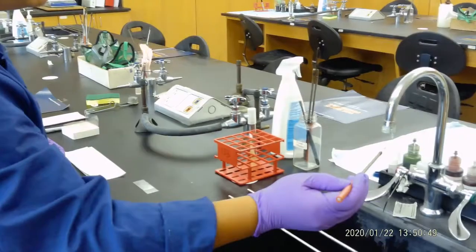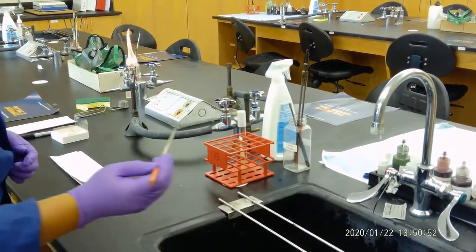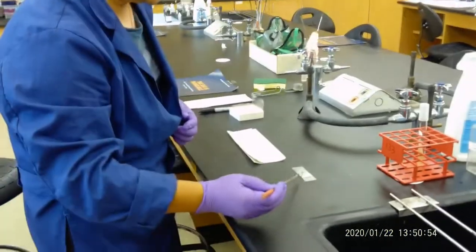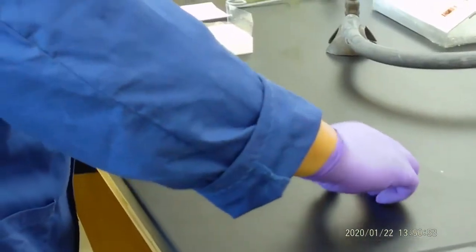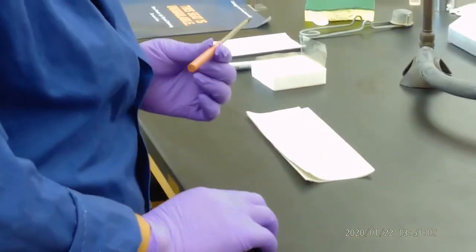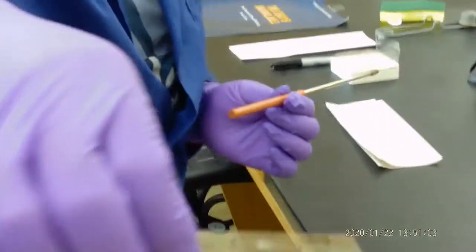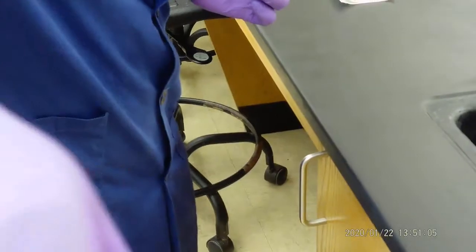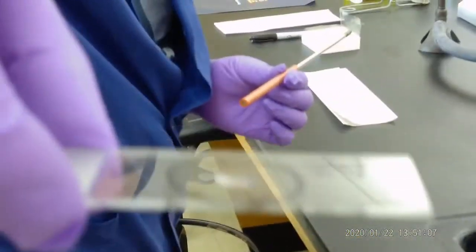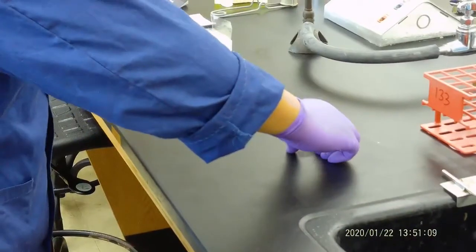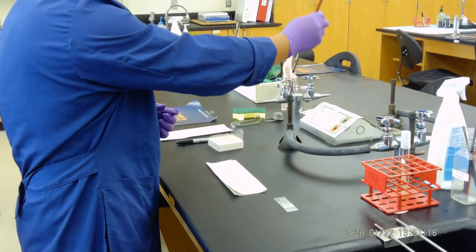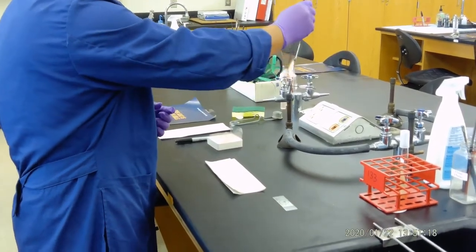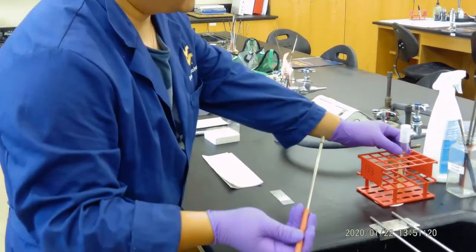Then we get one drop of the water, just a very tiny drop of the water in the middle of the slide. One drop of the water in the middle. Now we have to sterilize it because we are going to put bacteria there, that has to be sterilized.